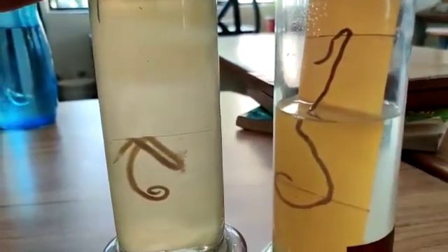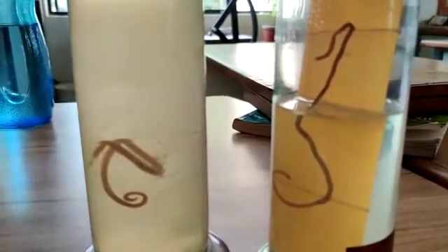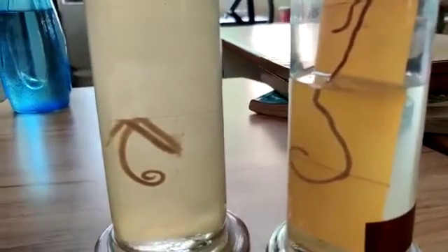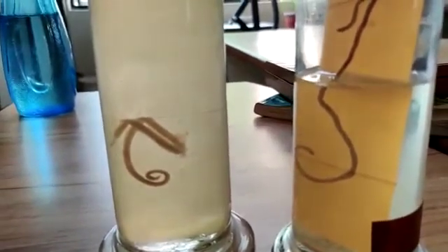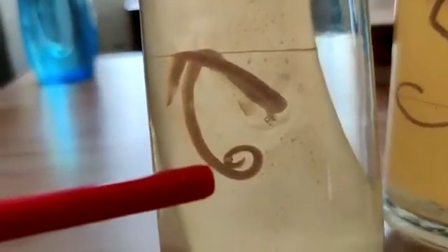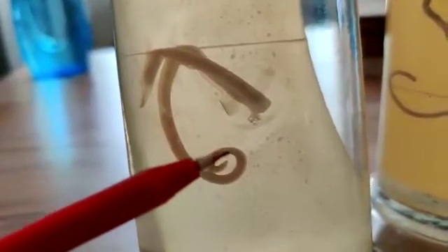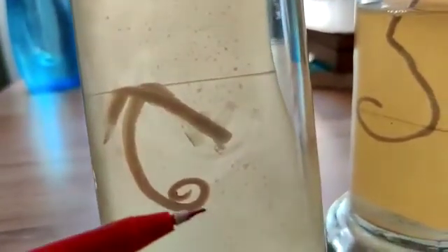This is the specimen of Ascaris, the roundworm. It causes a disease in humans called ascariasis. These Ascaris are unisexual, meaning male and female are different. You can see that the posterior end of this Ascaris is somewhat curved. So when it is curved, it means it is a male Ascaris. If it was straight, then it must be female.